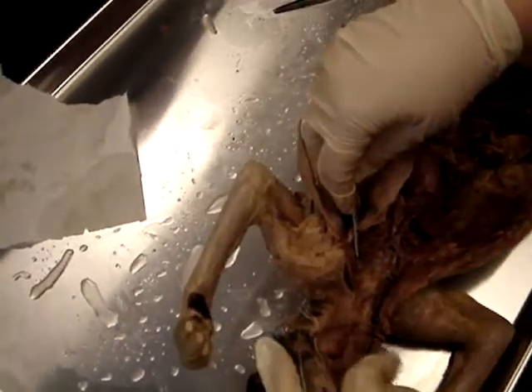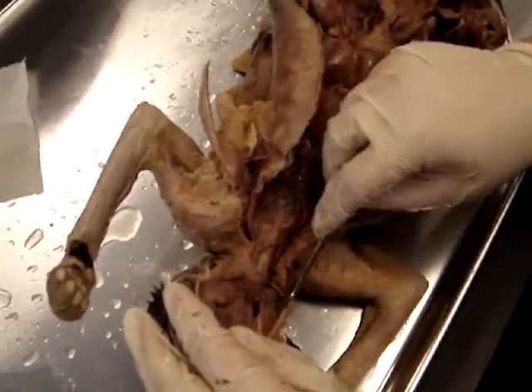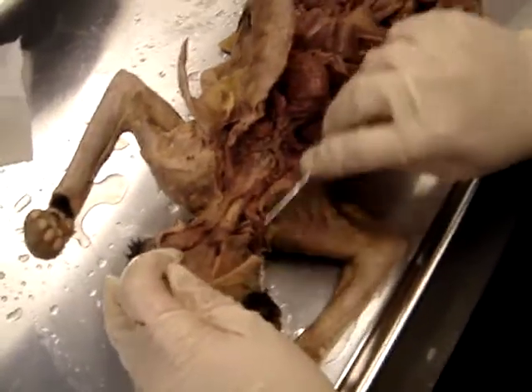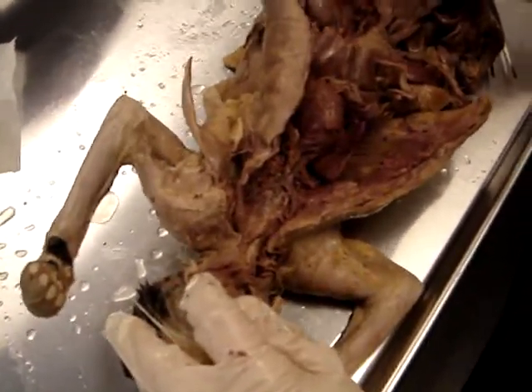And then they've all been removed from the front of this cat, but remember when there was a vein across here? That's the transverse jugular vein. And remember the veins that went down either side of the neck? Those are the external jugular veins. Okay, so you guys will have to find those on another cat.